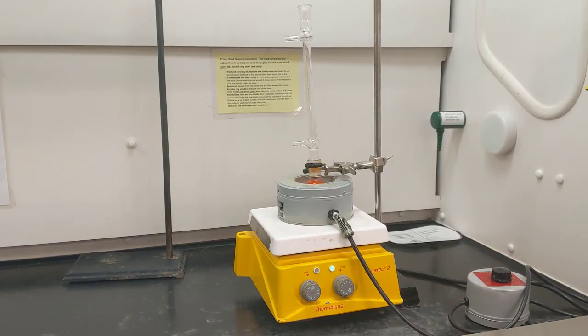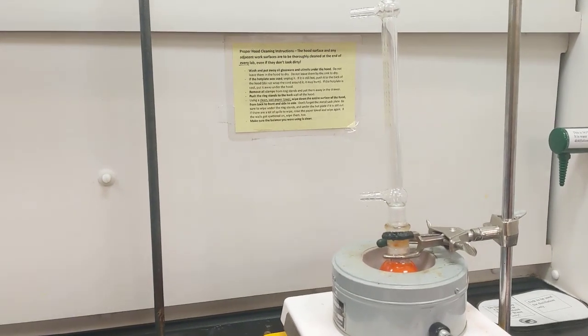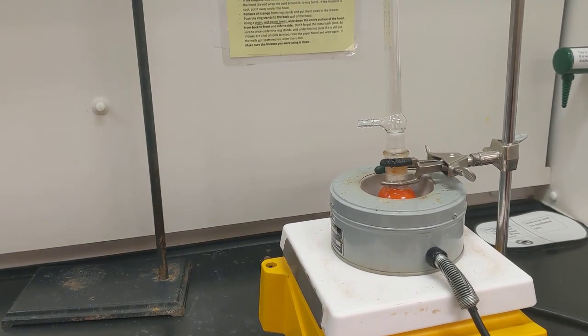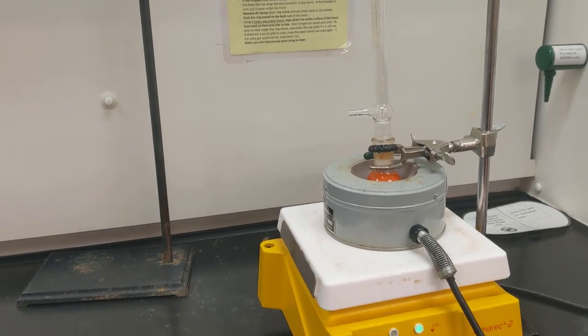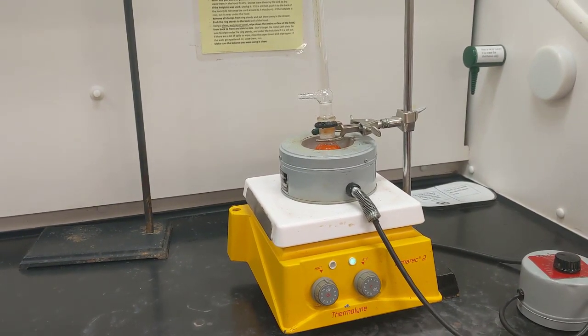All right, so I've been heating this reaction for a while, but if you look really closely at it, it's kind of the solid goo on the inside, so it's really hard to tell if it's boiling. So I'm just going to continue on to the next step, and I'm going to add my pre-weighed portion of sodium chloride.